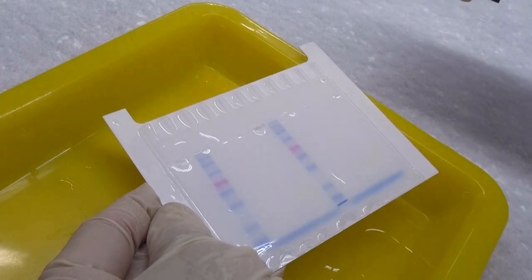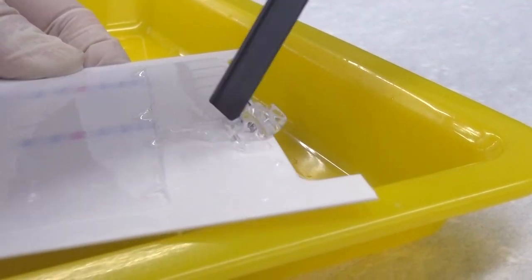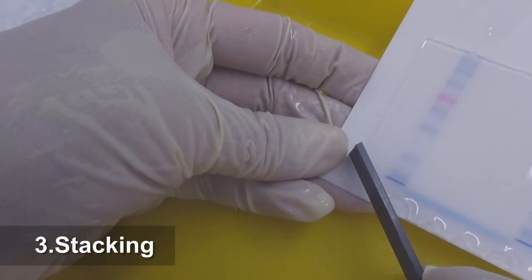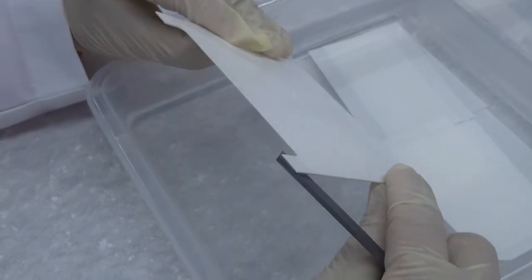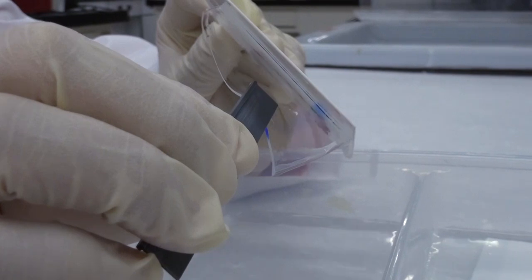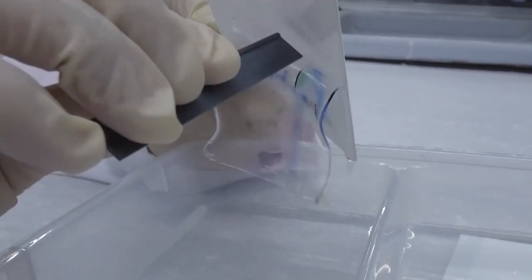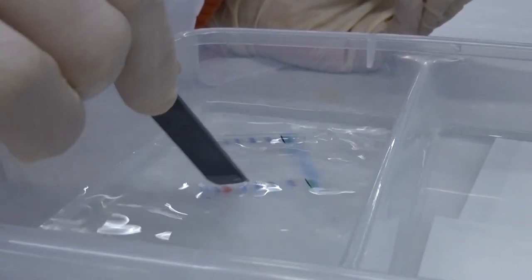Cut off the upper gel and push it away onto a piece of paper towel for disposal, so the discarded gel will not stick to other objects. Cut away the lower left corner of the gel as a reference of orientation. Invert the aluminum plate so that the attached gel faces downward. Use a spacer to peel the gel down to the third transfer buffer chamber. The gel will slide down acceleratedly due to gravity. The gel may absorb water and expand after prolonged soaking.